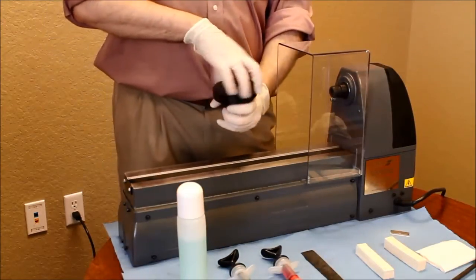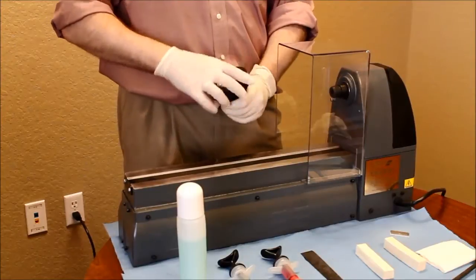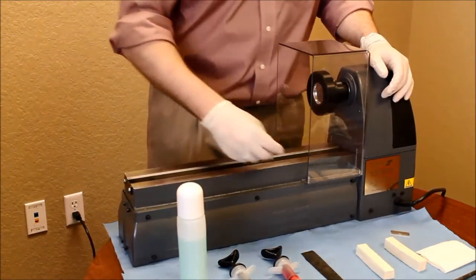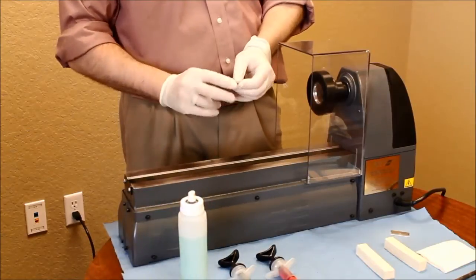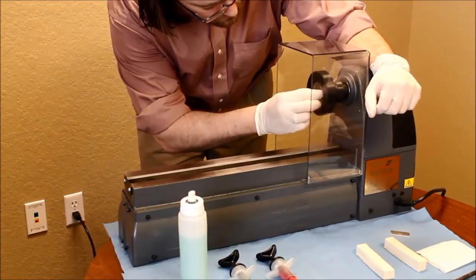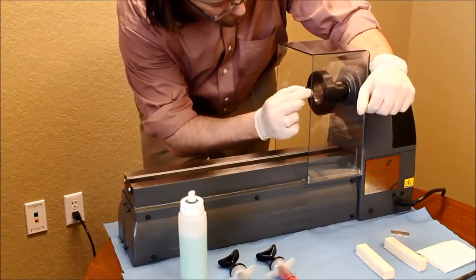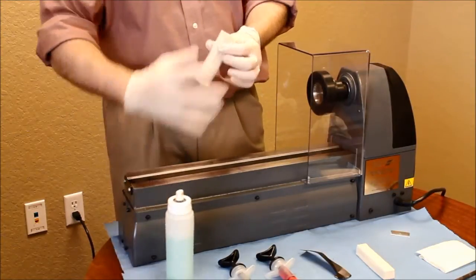The jig is assembled with the labware being placed inside. Once secured, sandpaper is oiled and used to begin the polishing process. The sandpaper is gently pressed towards the center from the outside. Once complete, the residual polishings are removed with a soft cleaning stick sprayed with oil.